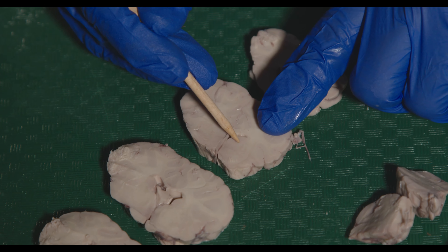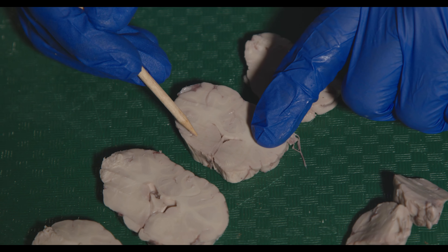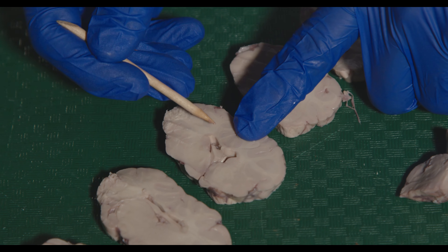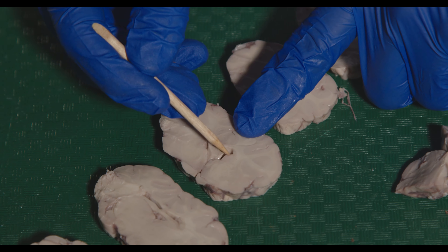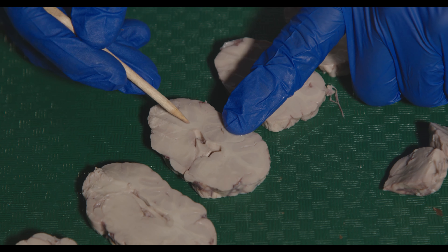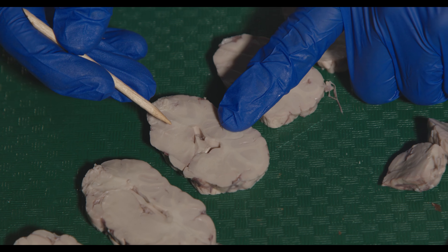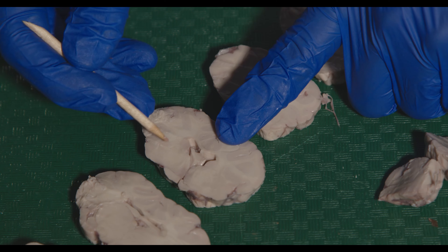What we really want to see here is this gray matter — the caudate, one of the basal ganglia structures. The putamen would be on the lateral side, and we're starting to see some of the internal capsule that separates them. Further along, we can see the corpus callosum going across and also the lateral ventricles. Immediately hugging the lateral ventricle is the caudate — visible on both sides. Going a little lateral to the caudate, you'll see the internal capsule: white matter fibers connecting the cortex to the brainstem. And then the putamen and the globus pallidus — which means pale globe and is hard to see on an unstained specimen.